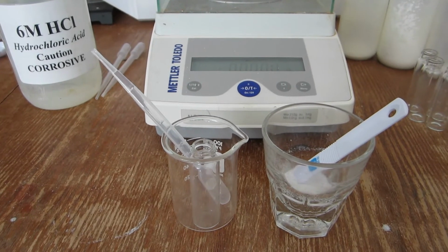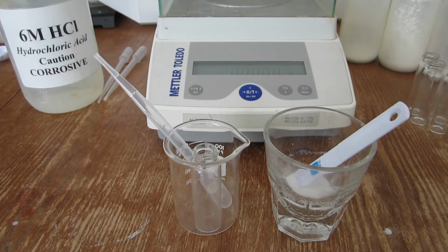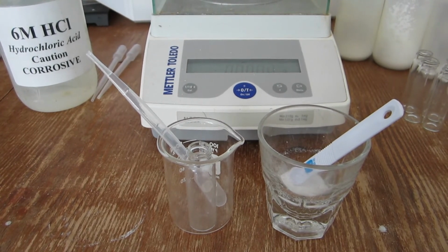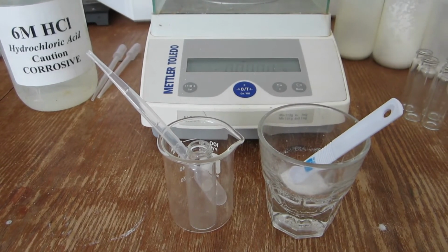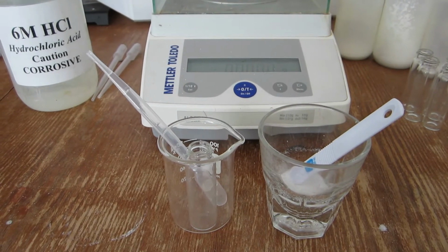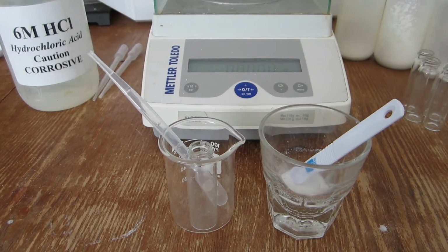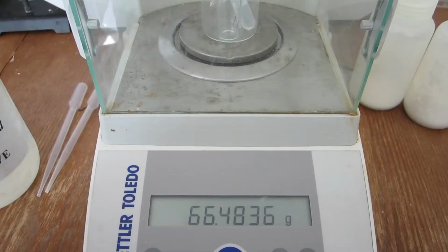In this unknown carbonate sample, it will be reacted with hydrochloric acid in 3 different trials. In each trial, you will determine the mass of carbon dioxide, the mass of carbonate, and the percent carbonate. In the end, you will take the average of these 3 trials to determine what is your average percent carbonate, and then compare that to a set of standards to identify what compound the unknown is.